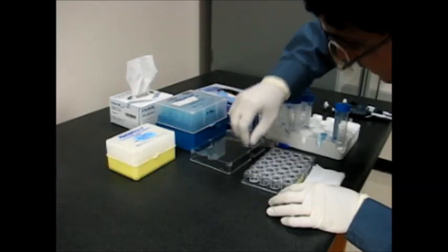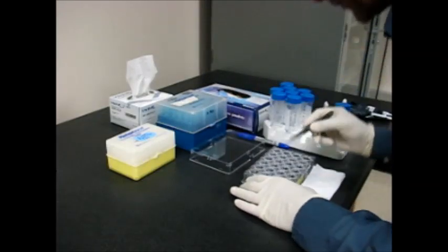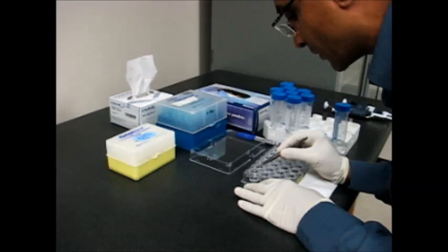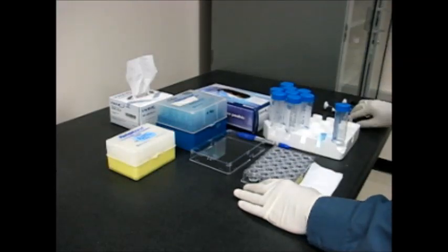Remember there is grease there, therefore you have to be careful setting it up and gently push on top to make the seal good.